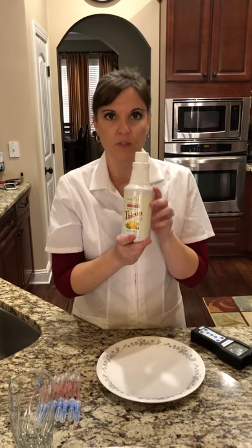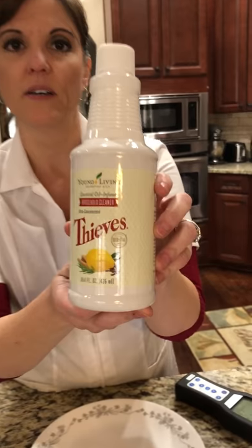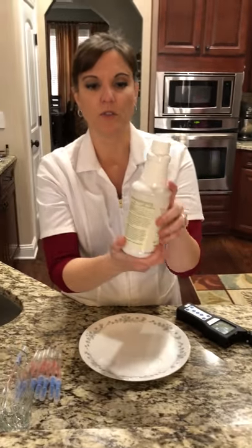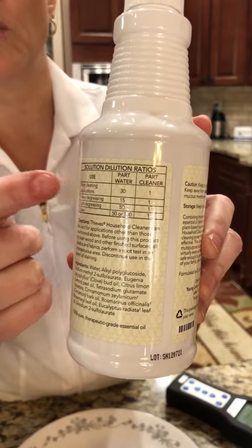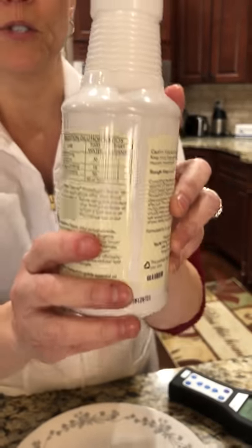Hi everyone, I'm Michelle Vargas and I'm going to be doing some recording of the testing of commercial products versus an all-natural plant-based product. This is the first thing we're going to do and two versions of it. This is Young Living's Thieves Household Cleaner Concentrate. We're going to dilute based on the recommendations — the heavy and the light degreasing formulas: the 1-to-15 ratio and the 1-to-50 ratio, and we'll do those independently.